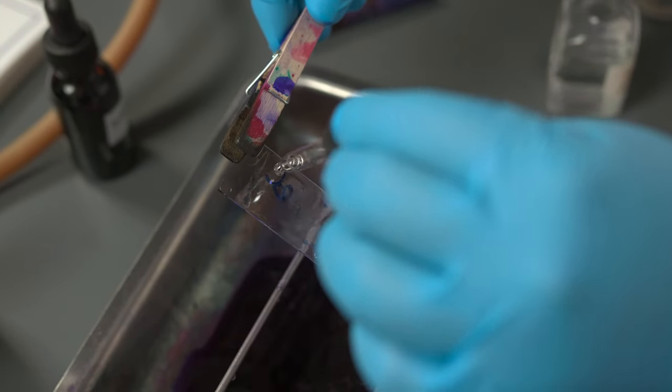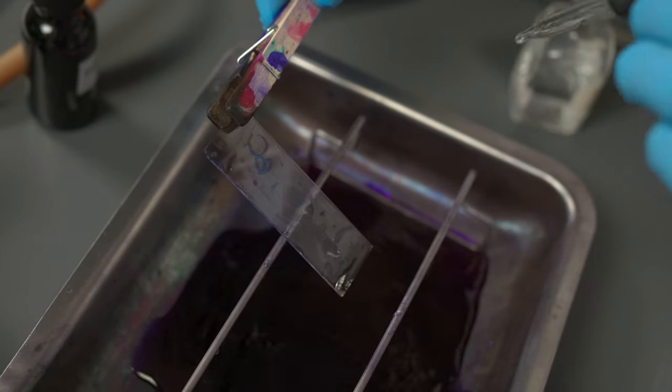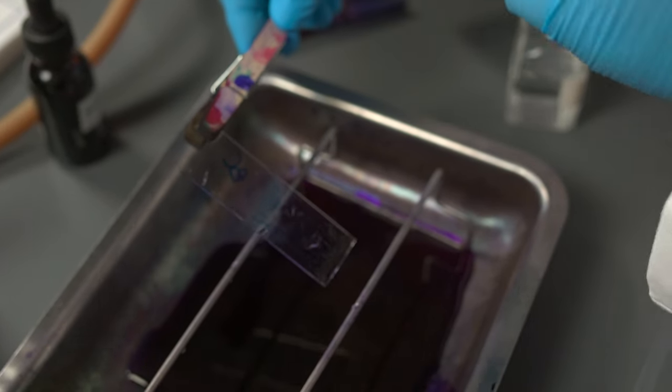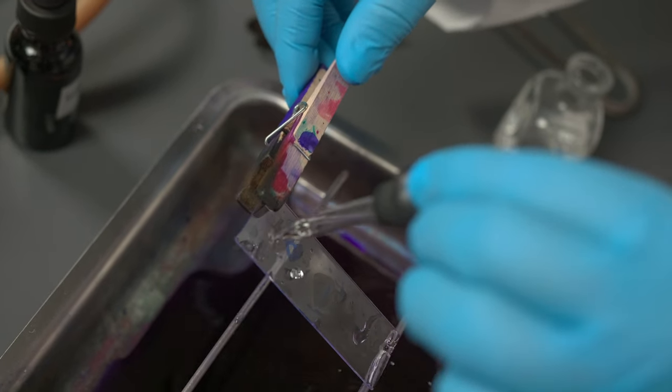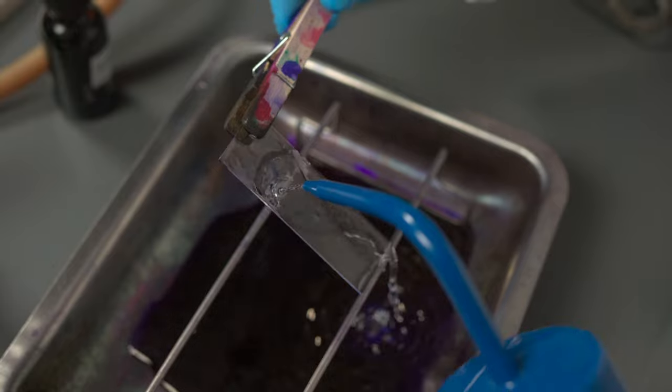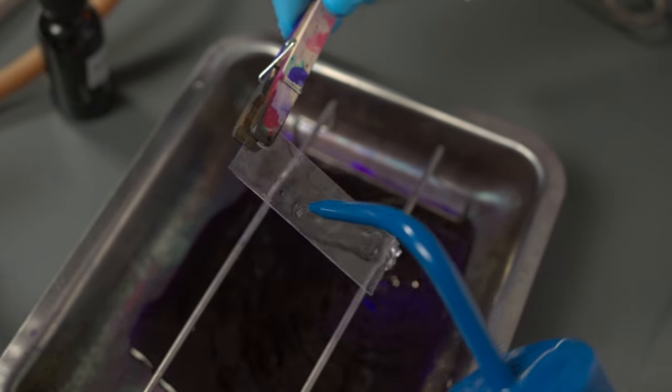hold the slide at an angle and decolorize it with ethyl alcohol until the alcohol runs clear. Rinse the slide with water.